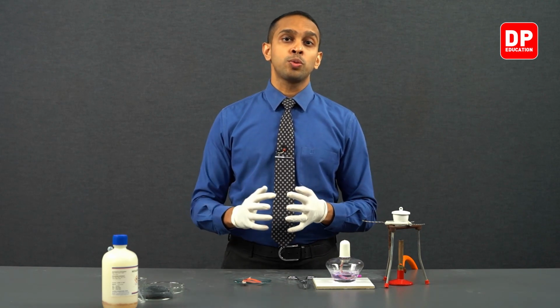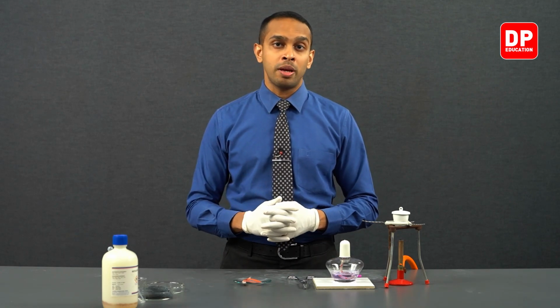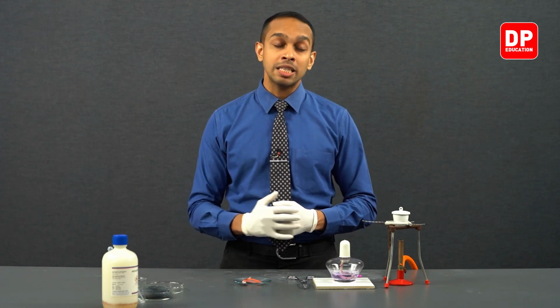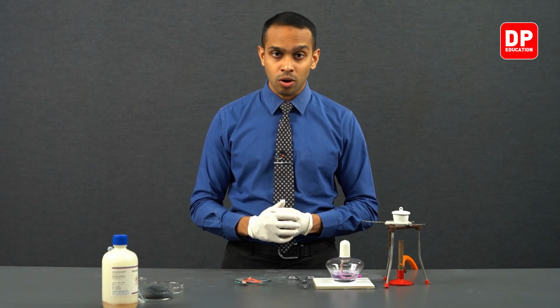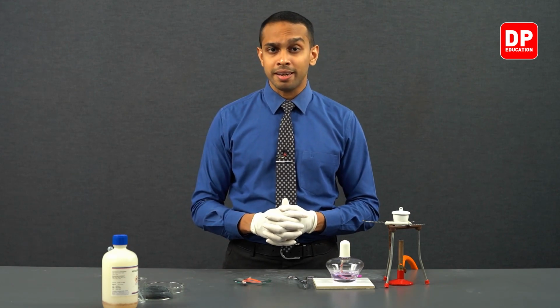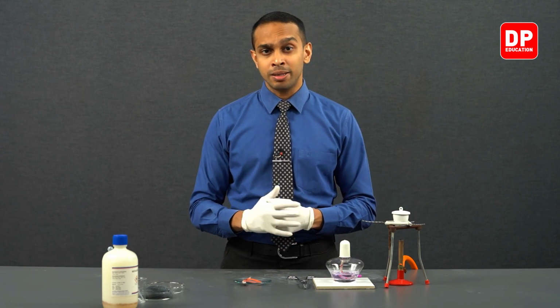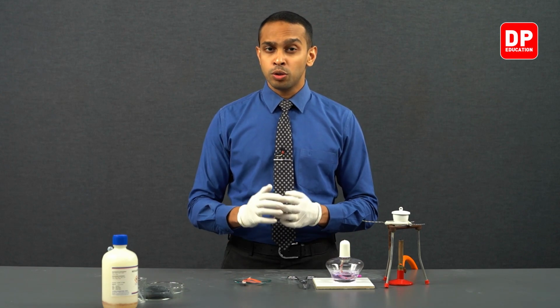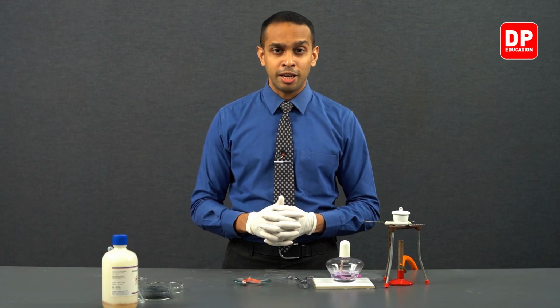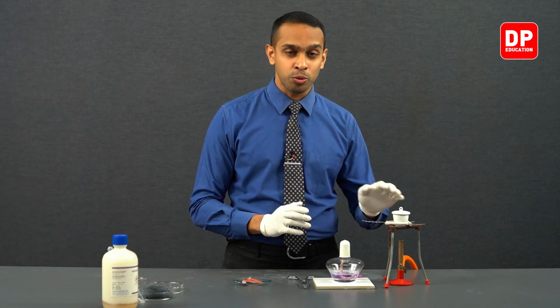As you know, when group 2 elements are heated in air, they are capable of forming their oxides alongside their nitrides. So if you take magnesium and heat it in the presence of oxygen or in the presence of atmospheric air, you are going to be producing magnesium oxide and magnesium nitride. So to make sure that this magnesium comes into contact with enough nitrogen and not only oxygen, we are going to conduct this experiment in a small crucible.